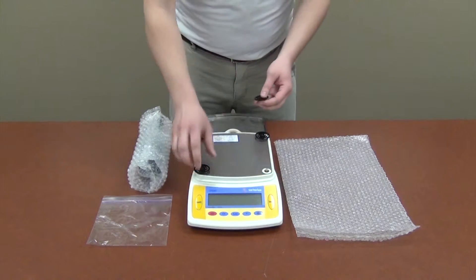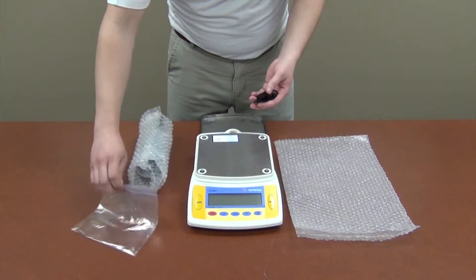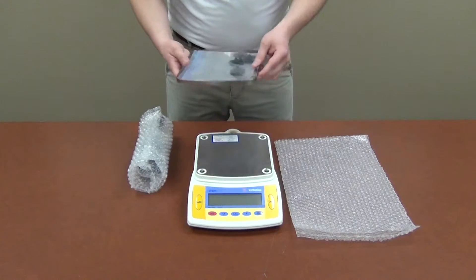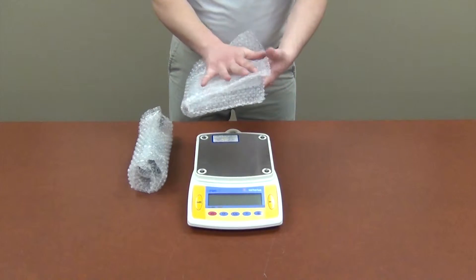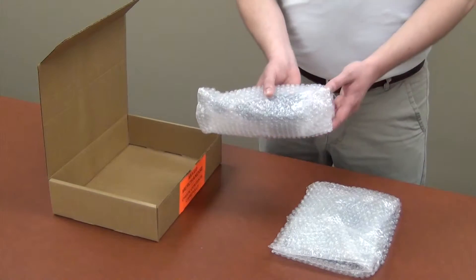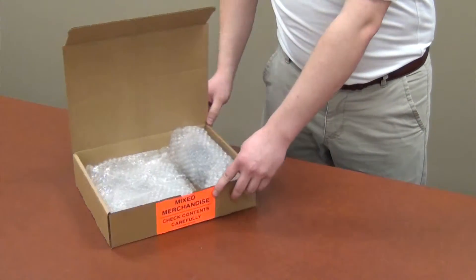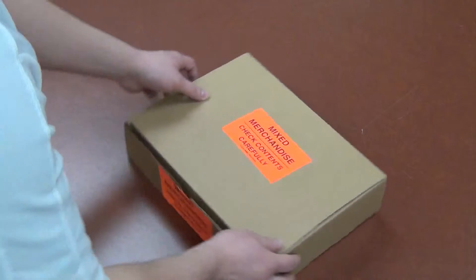Round pans may have a different type of support. Place the supports in a plastic bag, then pack the pan and supports in a bubble wrap pouch. Pack the power adapter and pan into the small box. Make sure to label the small box to identify its contents.